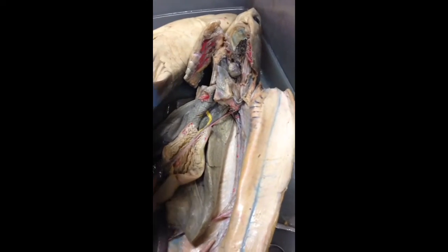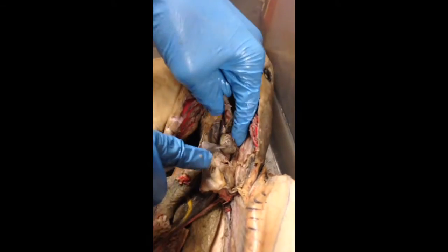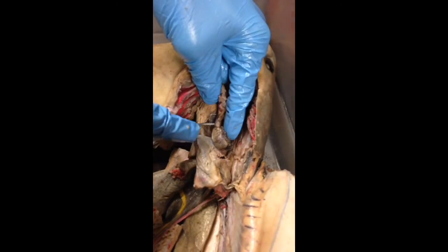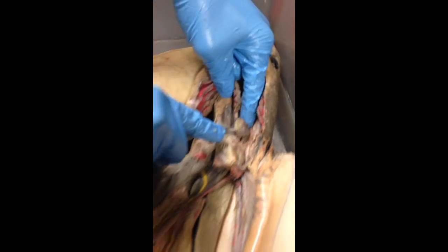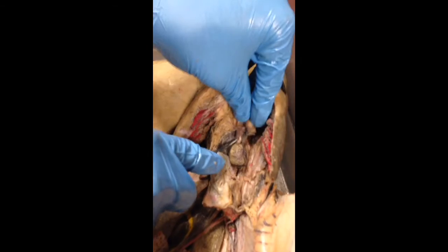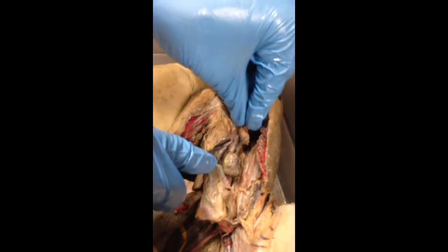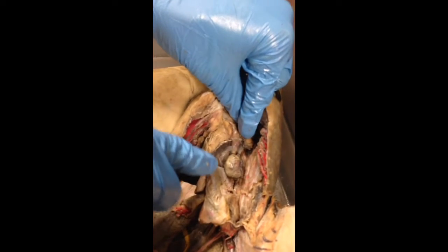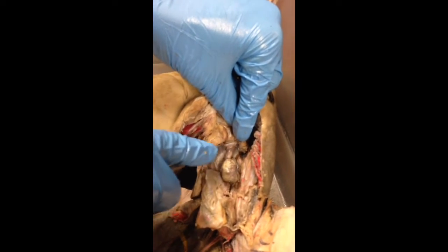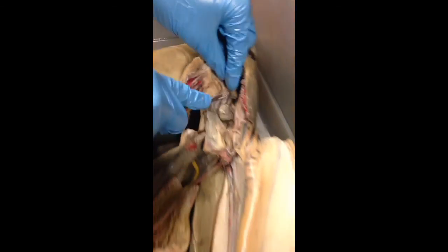Next thing on the list is the atrium, and the atrium is the smaller section of the heart — the top section, right above the ventricle. Next thing on the list is the conus arteriosus. We showed that already, and it is the large artery that connects out of the heart and delivers blood to the rest of the organism.